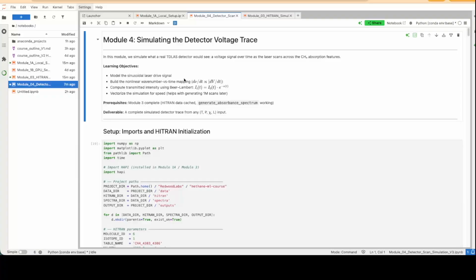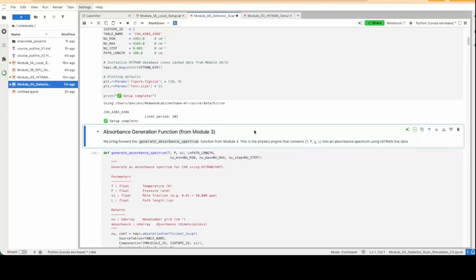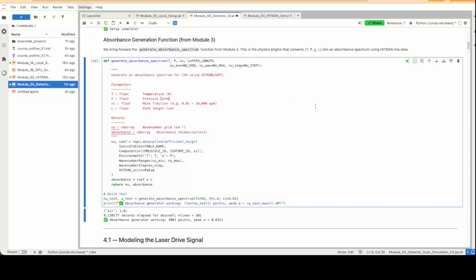So here we have module 4. We've already run module 1A, which is the local setup. Module 3 walks you through the simulation of absorbance using HITRAN. Here we build on that and then simulate what the response would be on the detector, the actual data we collect. So here we do some setup. We use the same generate absorbance spectrum function from module 3.